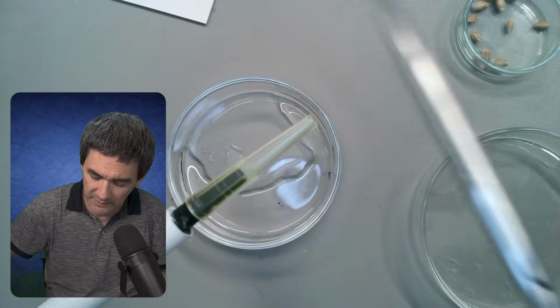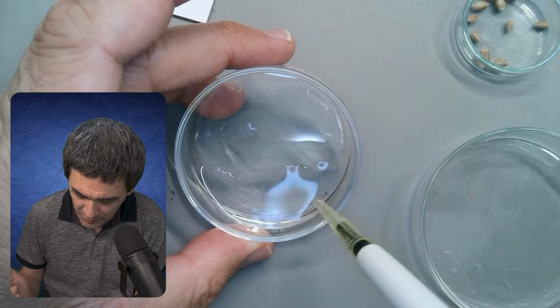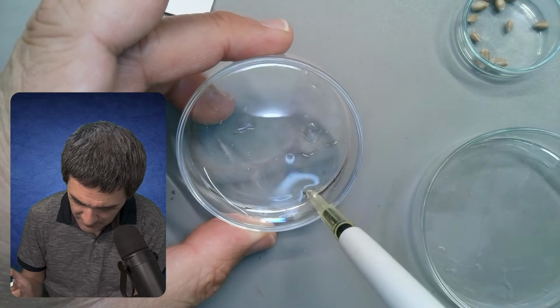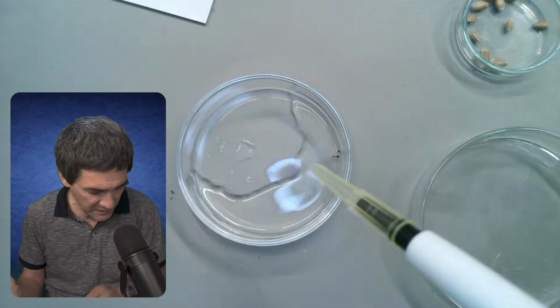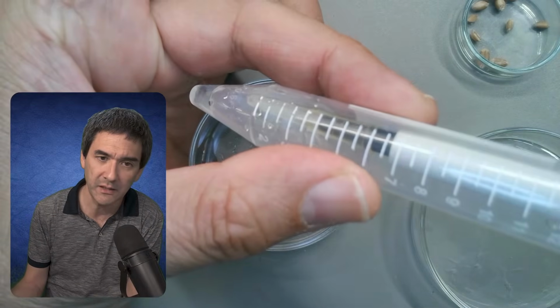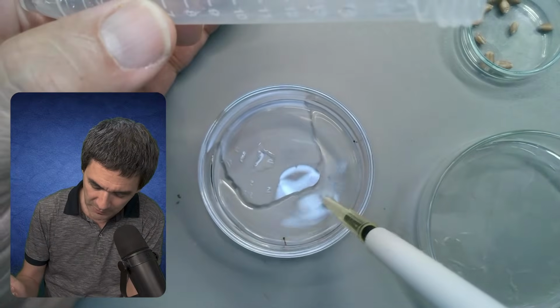So I'm going to go like this. And I hope to be able to, here's one. Did I get it? No, I didn't get it. Come on, up. Still not. Maybe it's easier for me to actually take them from here. Because I can't, it's not long enough. That's a pity. So what I'm going to do now is the following.